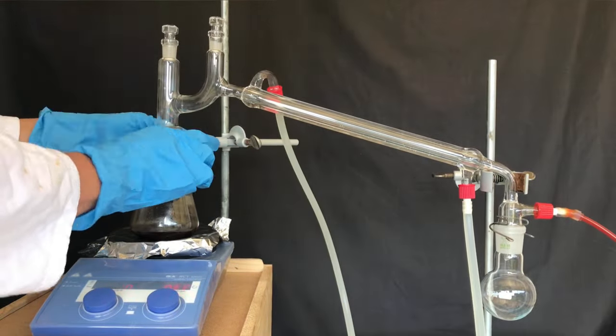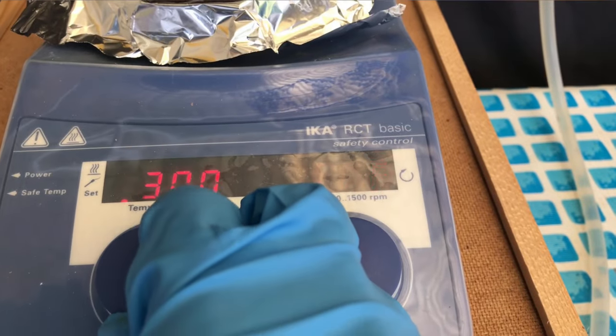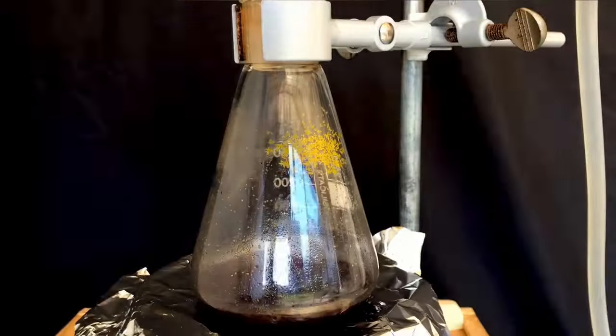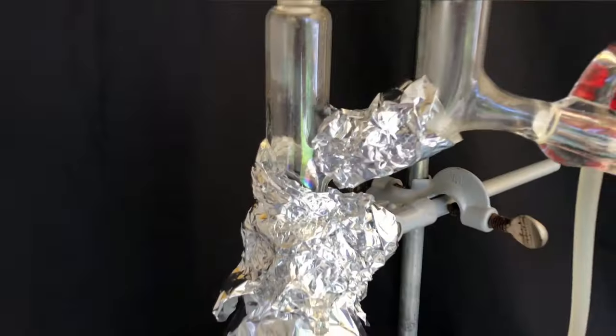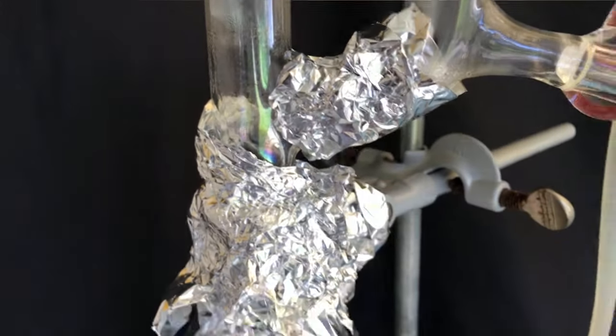If you do it gently, you could also use a blowtorch for this. This problem, which has now been solved, won't stop us anymore. The flask was heated, and it didn't want to boil over.